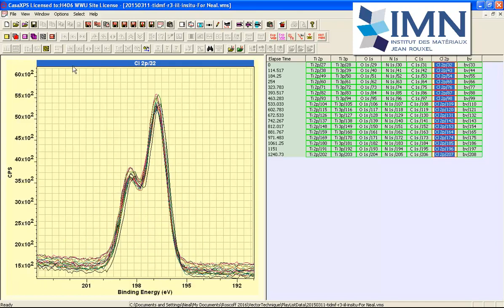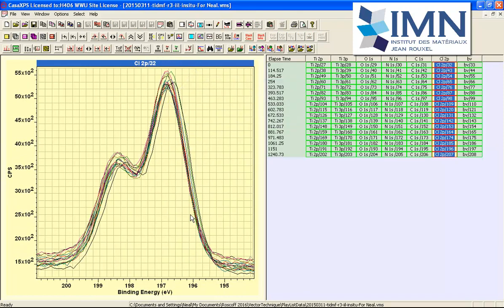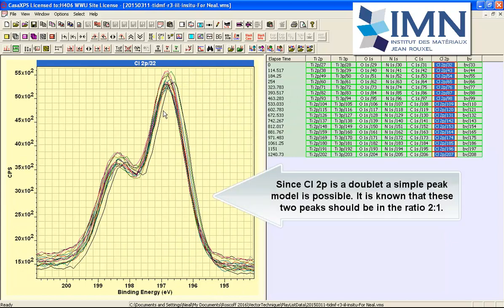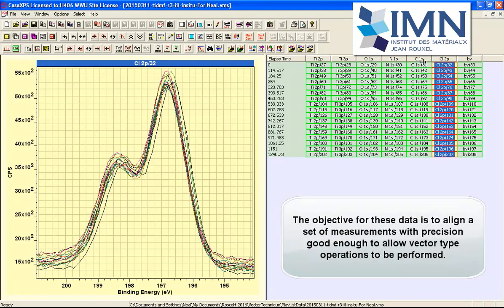However, in this case, we have the chlorine 2P, which is believed to remain fairly constant across the entire set of measurements in terms of binding energy. So what we'll do is we'll construct a peak model for these chlorine 2P doublet peaks, and we will shift this entire set of chlorine peaks so they all align, and at the same time we'll shift all of these other spectra corresponding to each row of chlorine peaks in this data file. So the compensation will be calculated based on the chlorine and then applied to a row, and this process will be repeated for all of these chlorine peaks, so the whole file will then be corrected to compensate for any shifts in peaks due to the charge state of the sample.